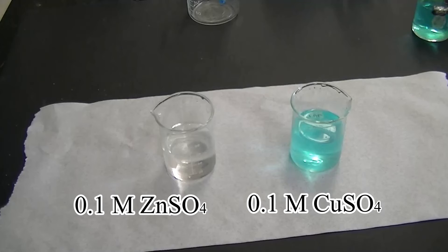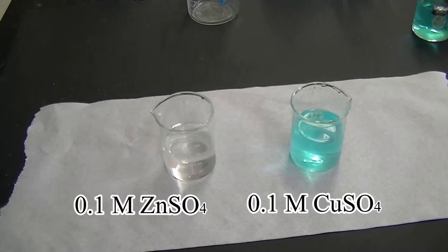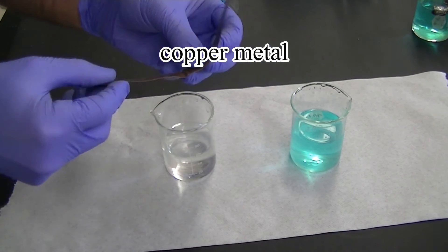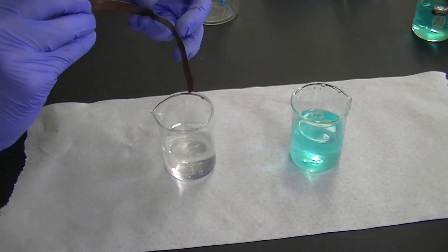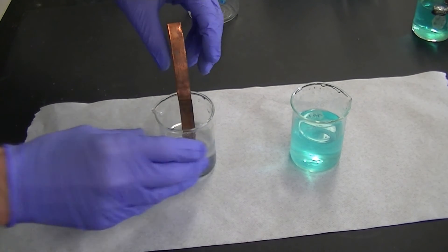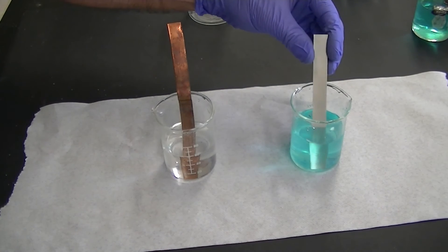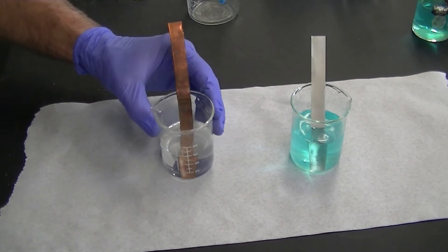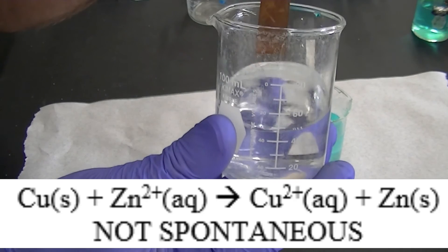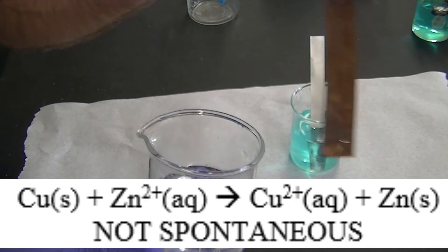The colorless solution on the left is a solution of zinc; the solution on the right that's colored is a solution of copper. I'm taking some copper metal and placing it in the solution of zinc, and now I'm taking some zinc metal and placing it in the solution of copper. Looking at the copper metal, I don't see any residue forming, which means the reaction between solid copper and aqueous zinc is not spontaneous.